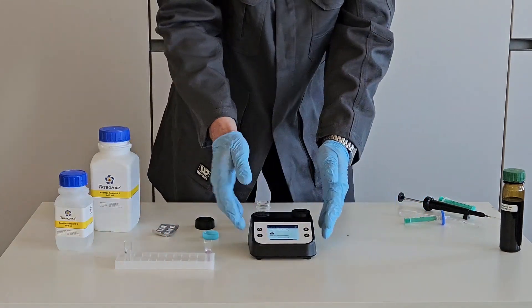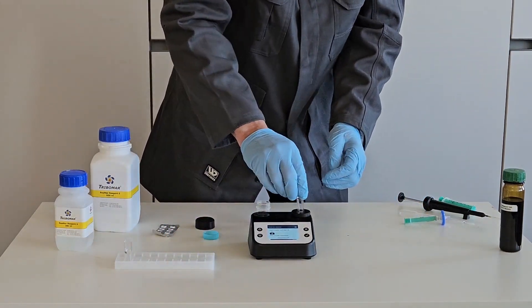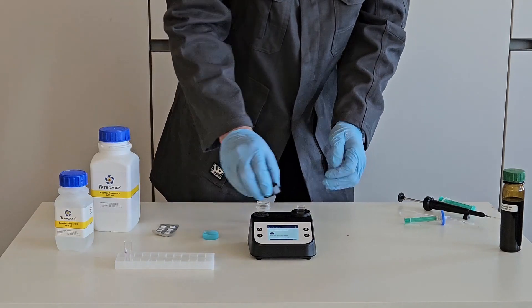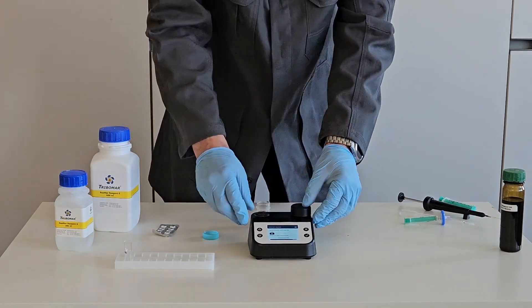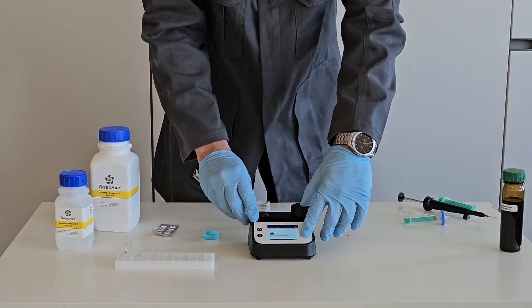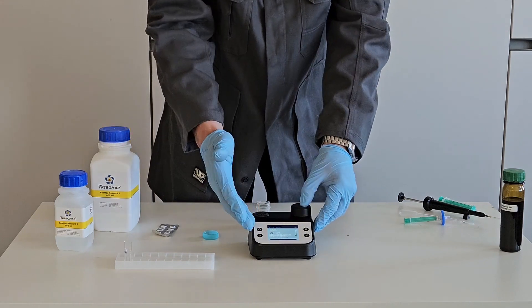Again, put the sample cuvette into the holder and close the lid. Press OK and the measurement starts with immediate result.